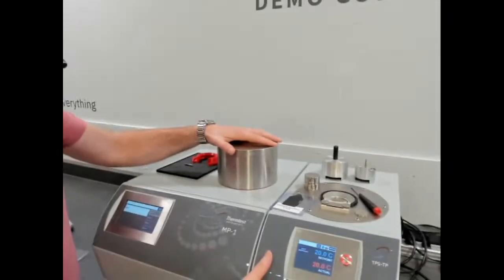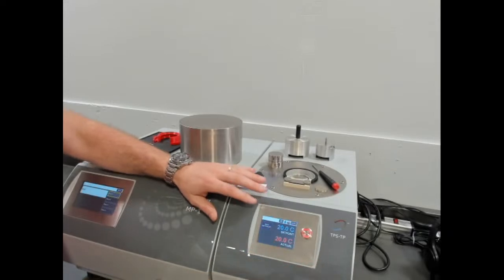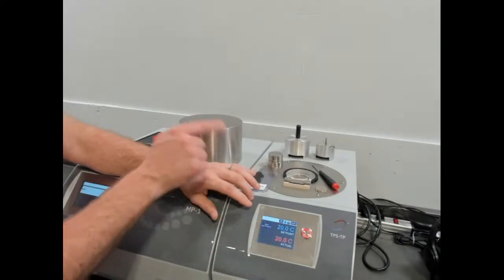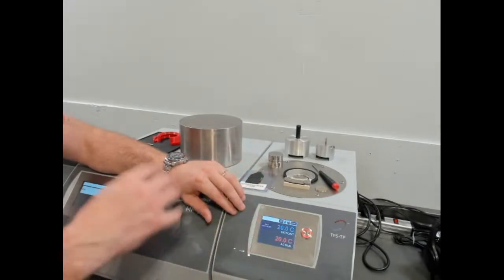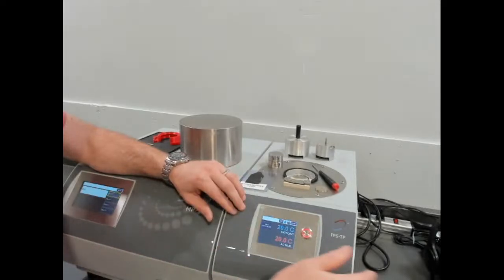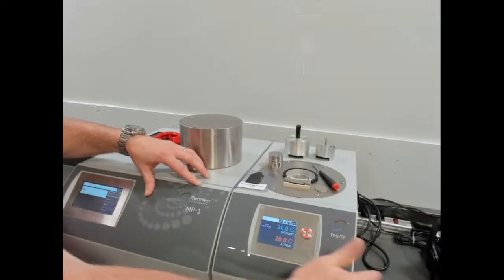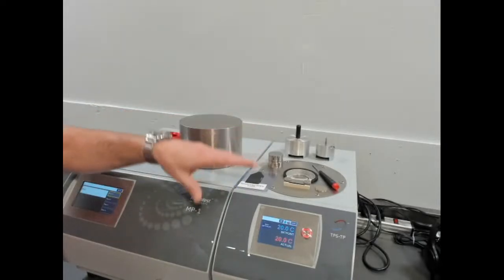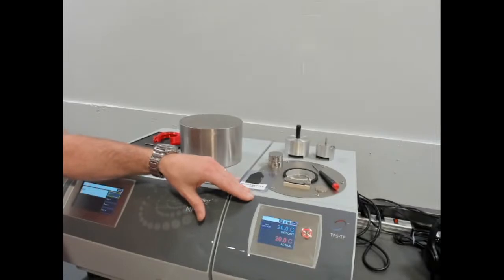So this is our temperature platform. The TPS TP stands for transient plane source temperature platform. The base temperature range of this is 0 to 300. And the thermal conductivity measurements are done at discrete steps of temperature. So it would go to each temperature, stabilize, make a measurement, or a number of measurements at that temperature, and then you can move on to the next temperature. Because the MP1 has multi-channel, you could actually add multiple temperature platforms side by side if you needed them. The optional range that you can extend this to is -45 to 300, or -160 to 300 Celsius.